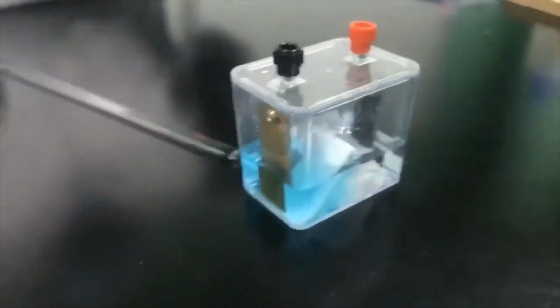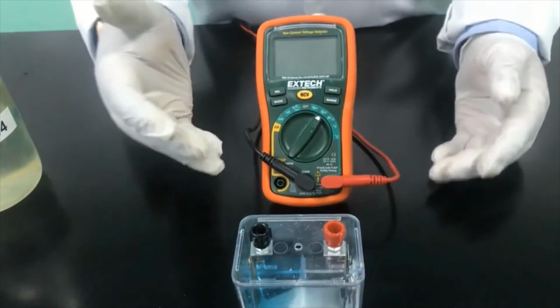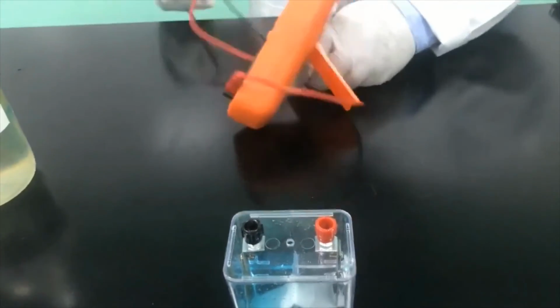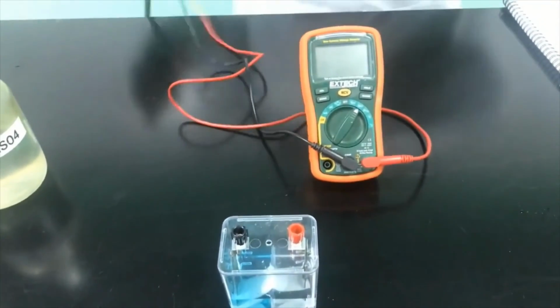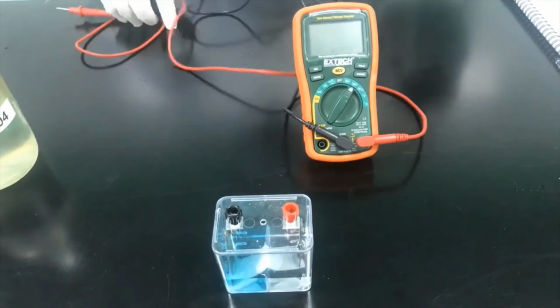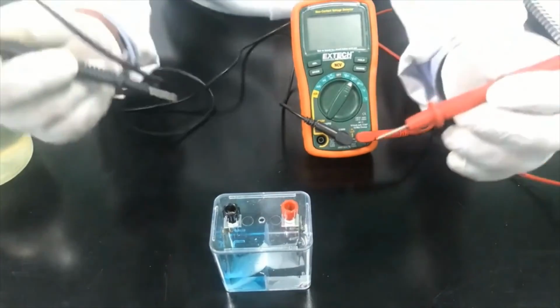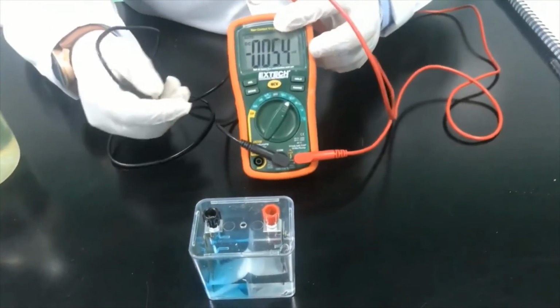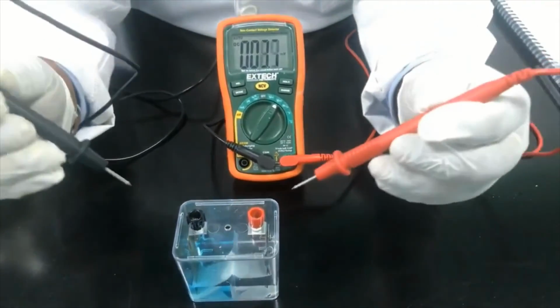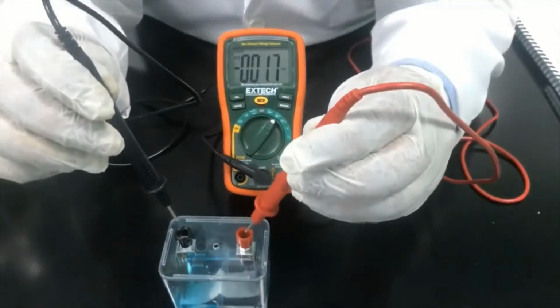In order to make the observation, we are using a multimeter to prove that we have electrons in the zinc and the copper. If we connect them externally, it will allow the flow of current, and we should be able to see that. Here you can see I'm connecting the zinc. Let me switch it on. Okay, it should be DC current. When I connect them, you may observe the flow of current and it will create a voltage.